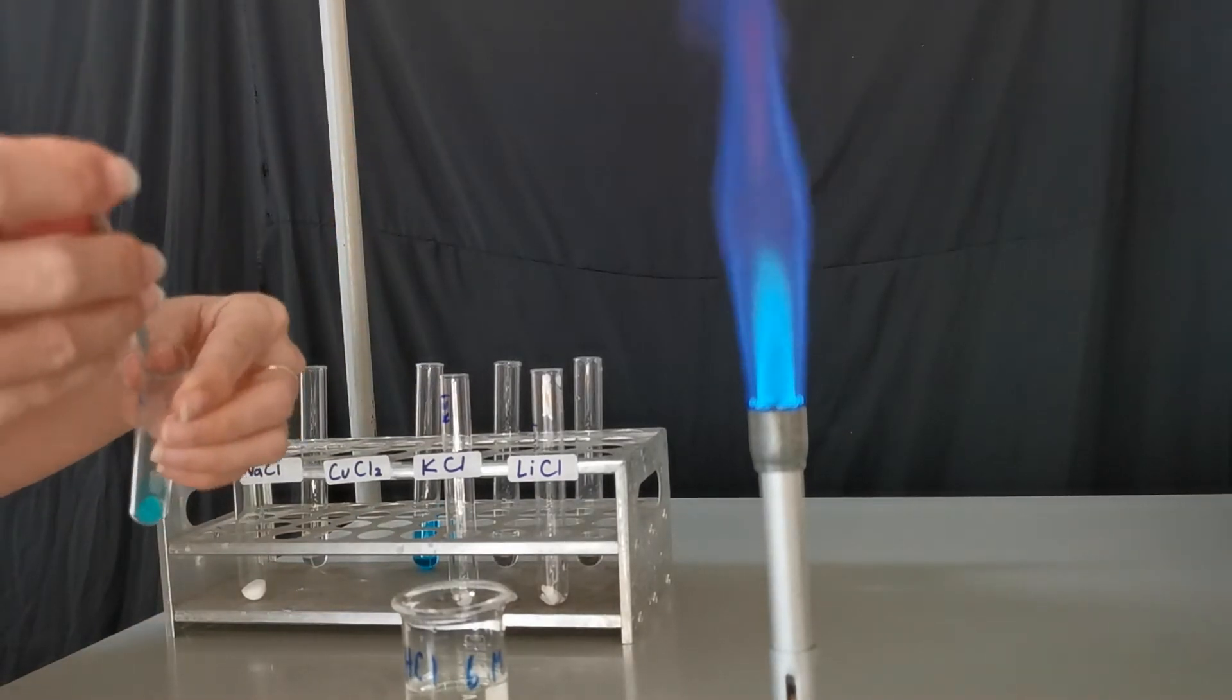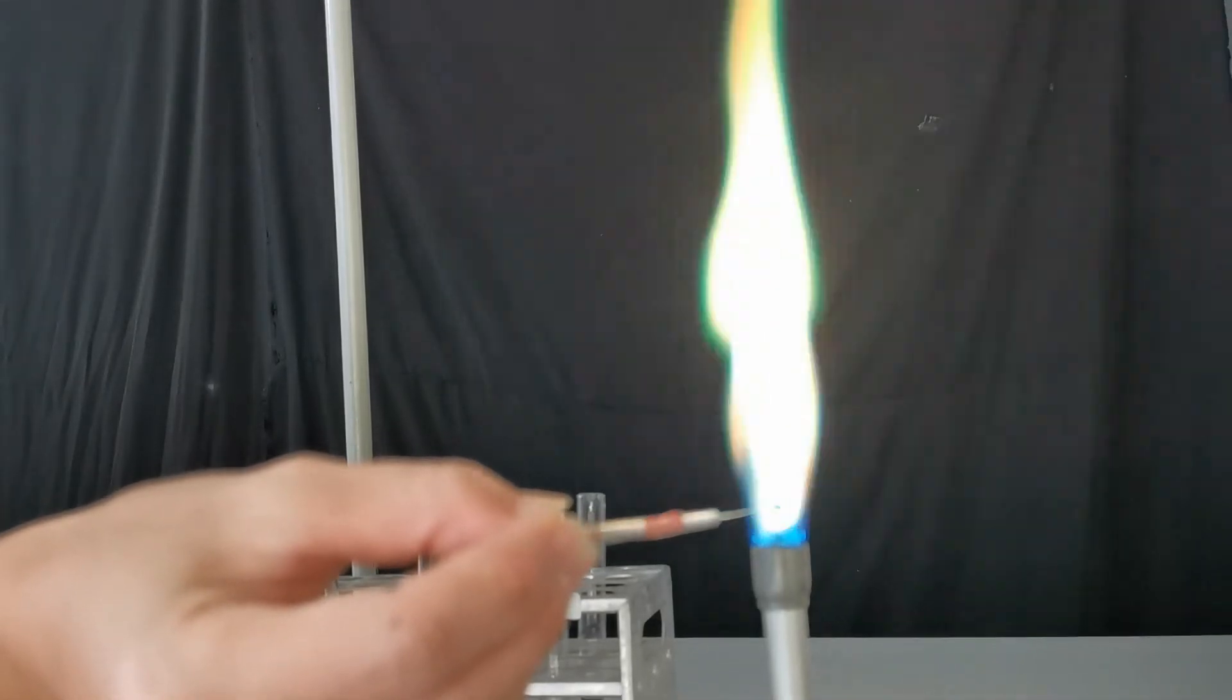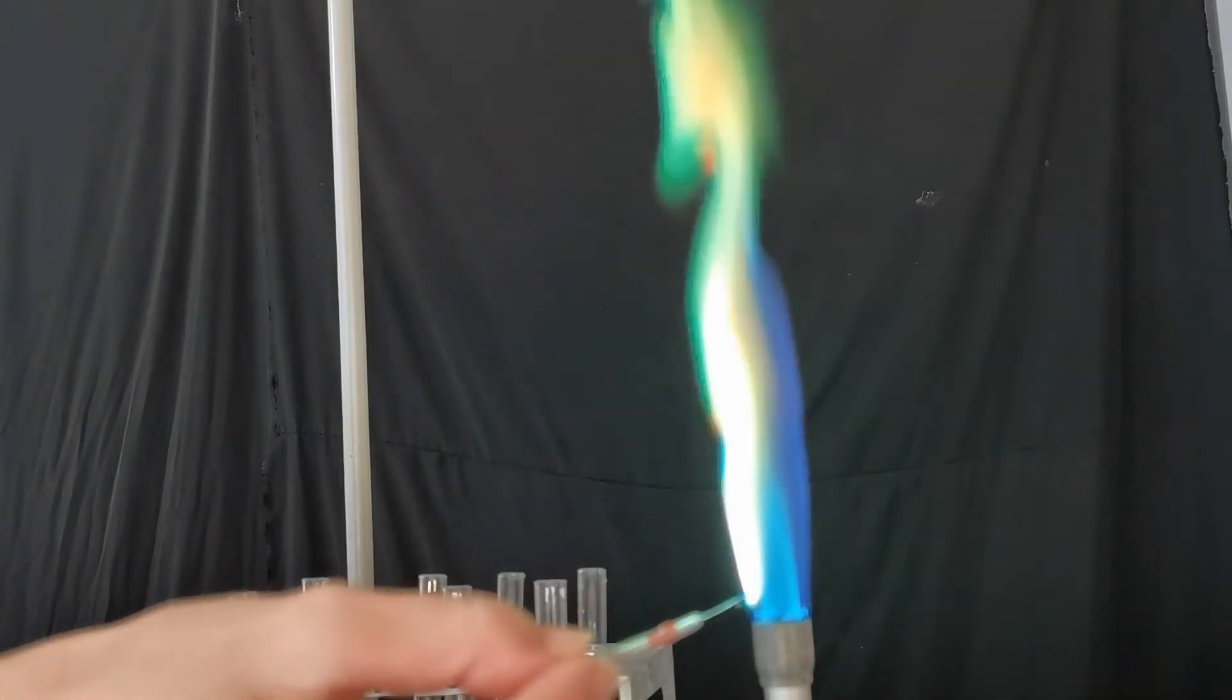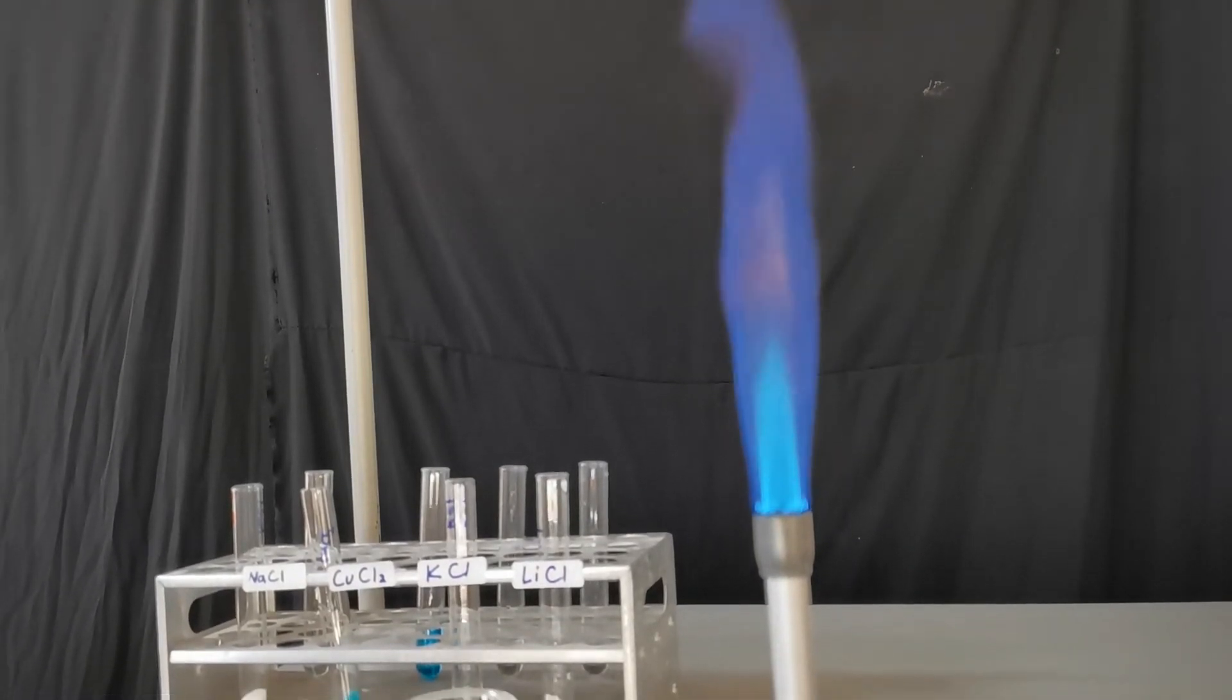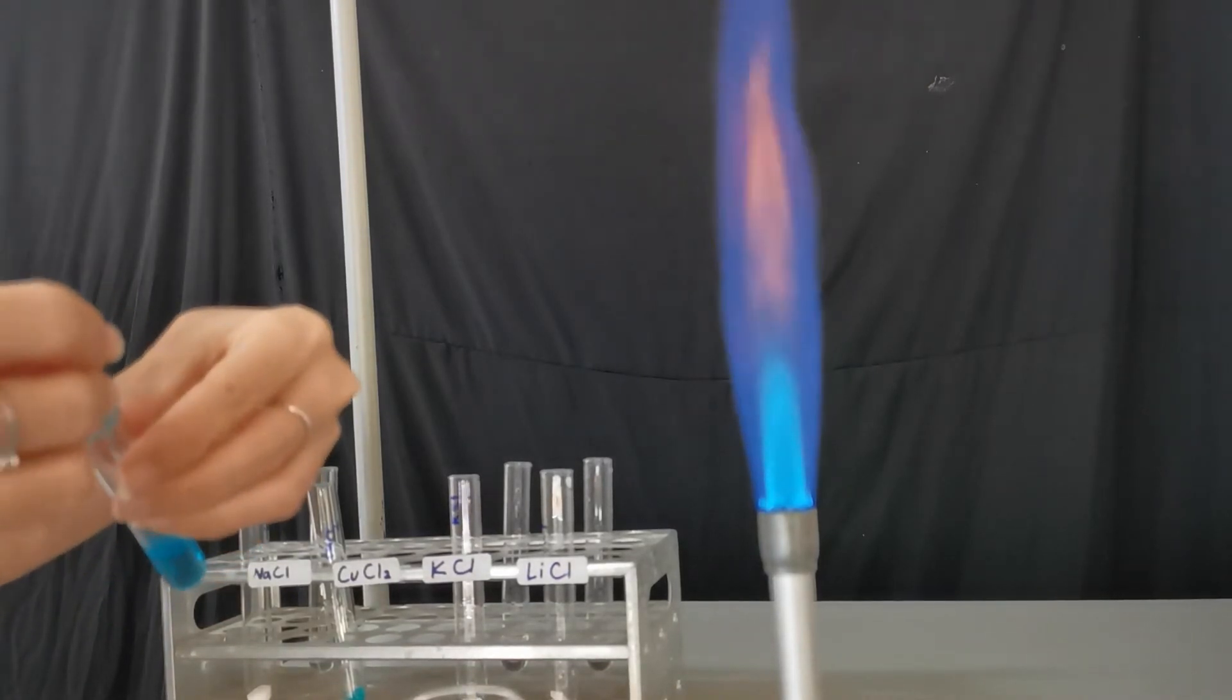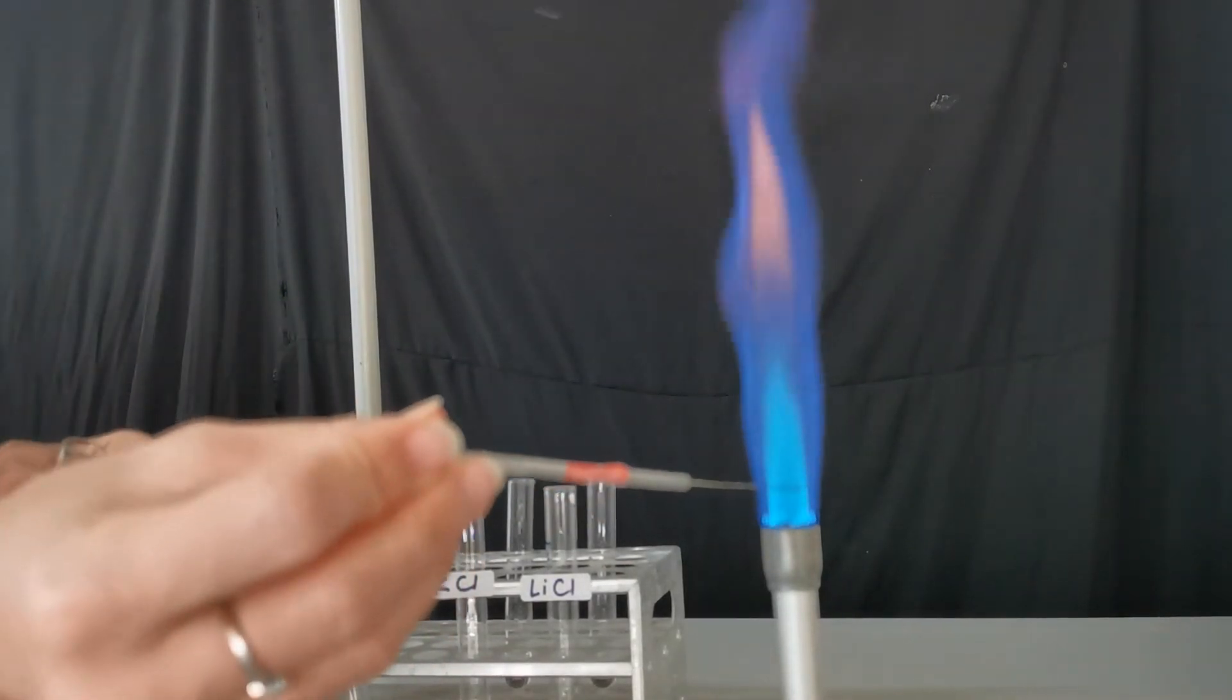You can see the blue-green color, blue-green flame produced by copper ion. This time it still gives you blue-green color. One more time.